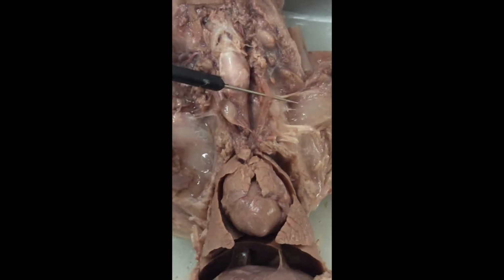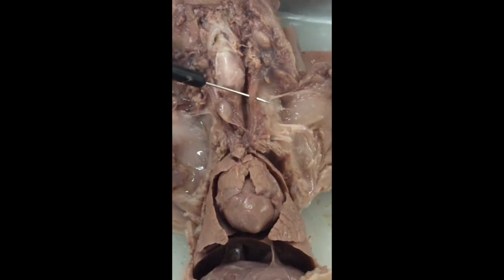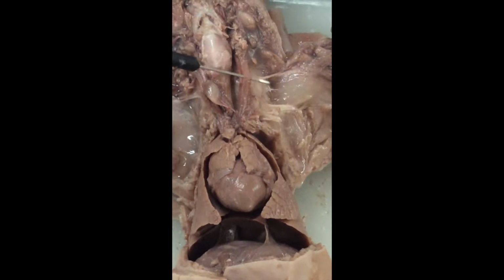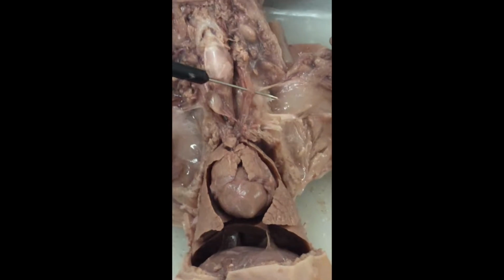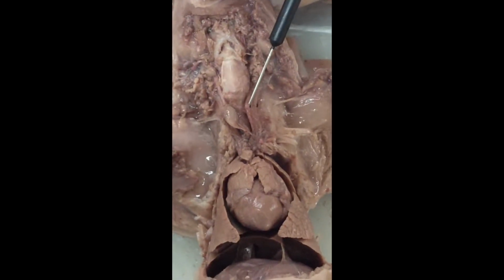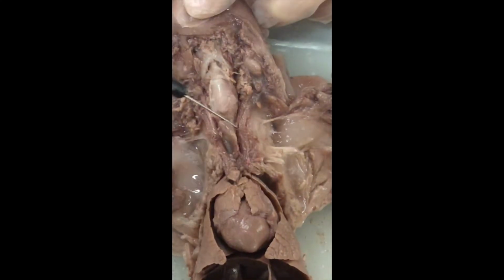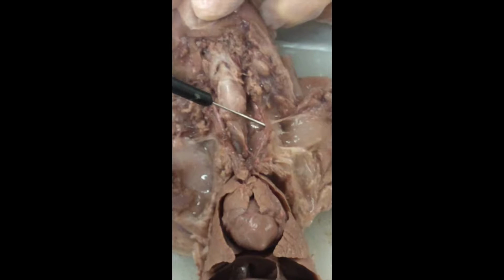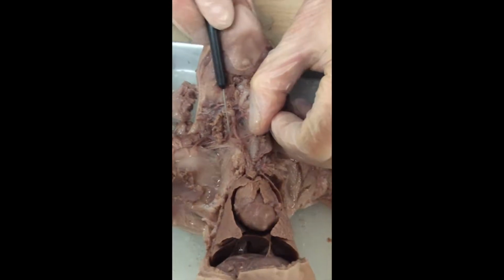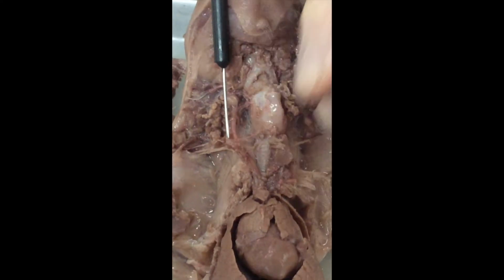The term vein identifies a vessel that carries blood back to the heart. Arteries carry blood away from the heart. Artery A, away. So the arteries, like the carotid, need to have a much tougher wall because they experience much higher blood pressure. So we've got the jugular vein there, and on the right side we have the collapsed jugular vein here as well.